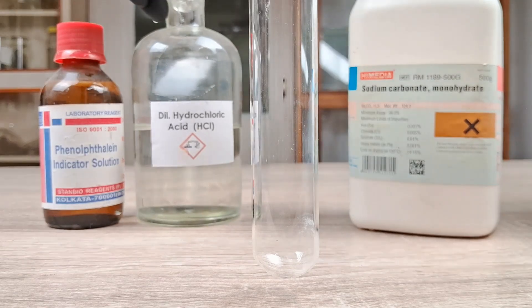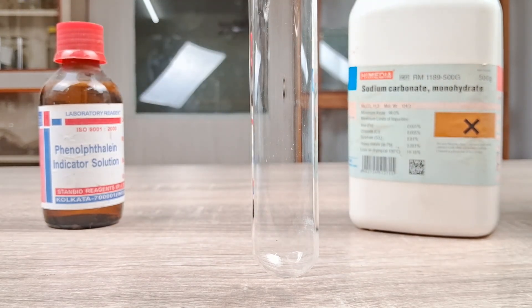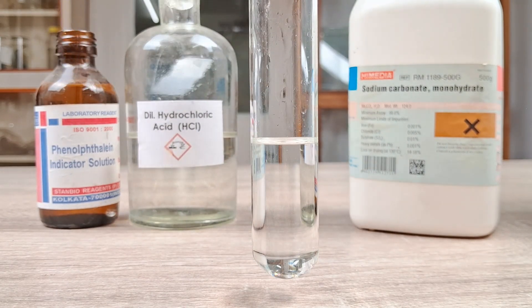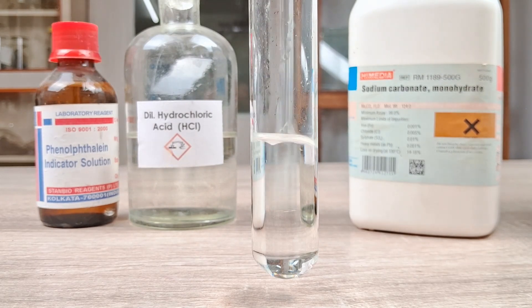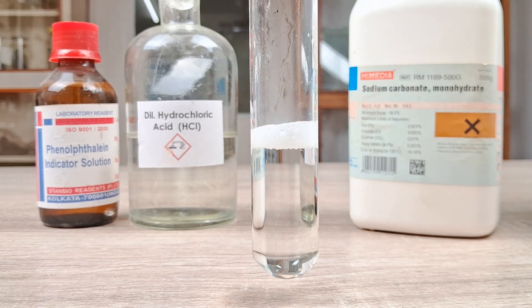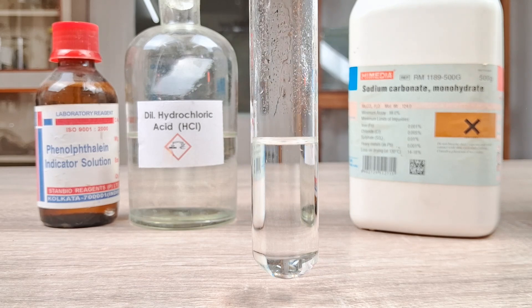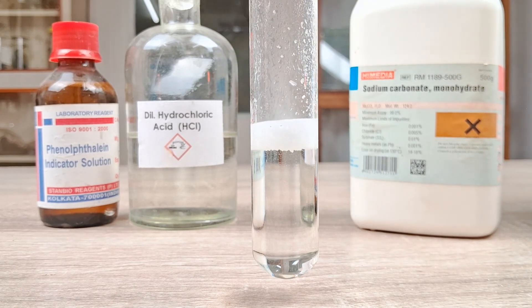To perform this neutralization reaction, take a test tube or a small beaker and add about 5 to 10 ml of dilute hydrochloric acid to it. Add 2 to 3 drops of an indicator solution, such as phenolphthalein, to the acid. Next, add sodium carbonate powder to the acid in small increments. Continue adding the carbonate until the reaction ceases and neutralization is achieved through a change in the color of the indicator.